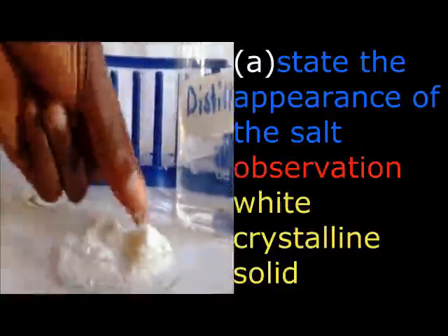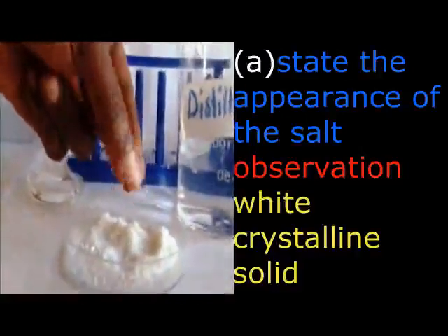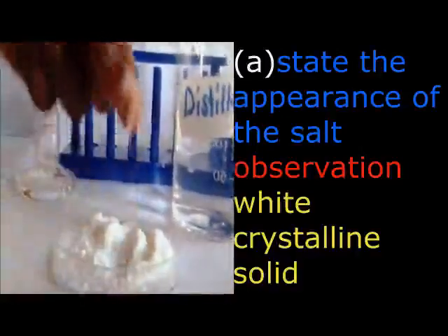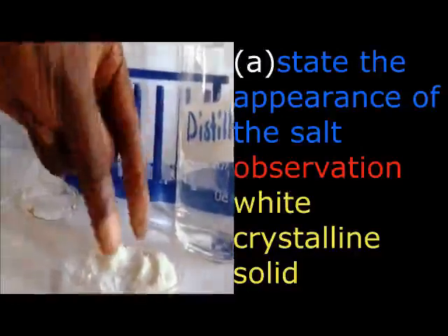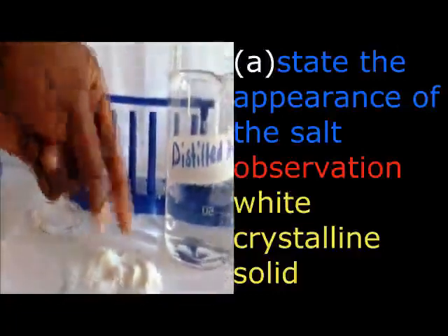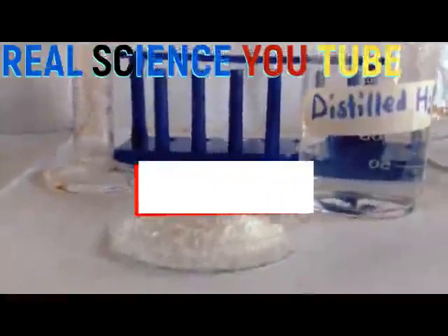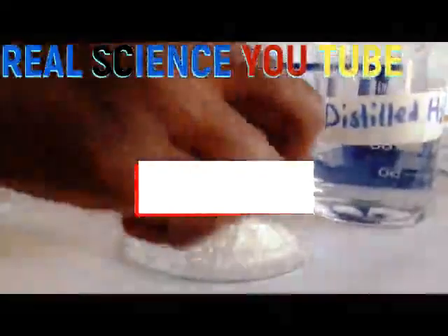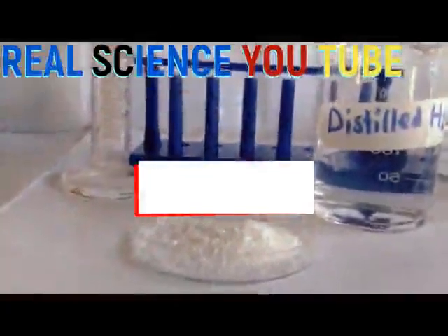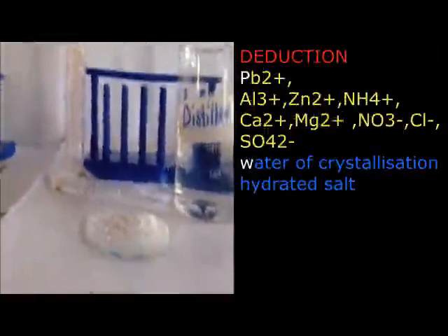As simple as that. Then when we come to our deduction now, because it is white, we are going to outline all the non-colored cations mainly. So we shall mention here lead, aluminium, magnesium, calcium, and so on, the non-colored ones. Then we can even add ammonium cation.